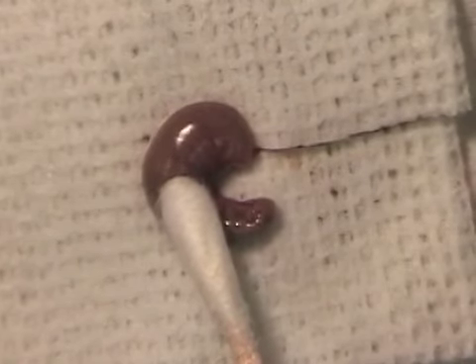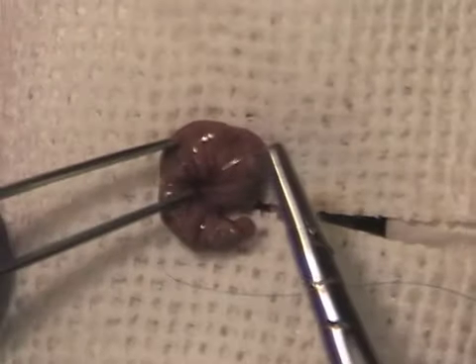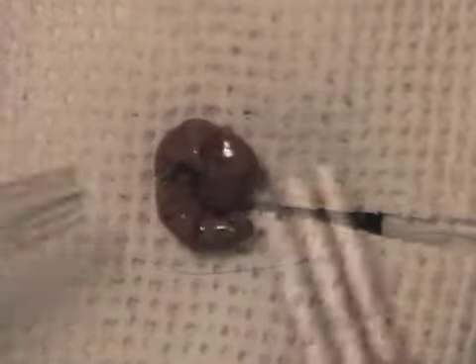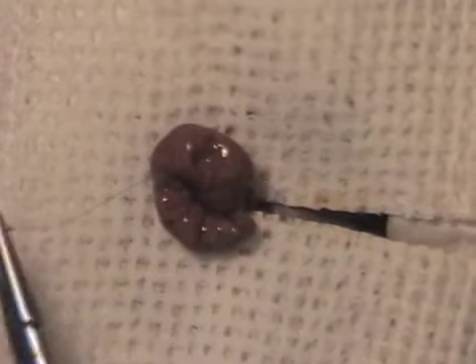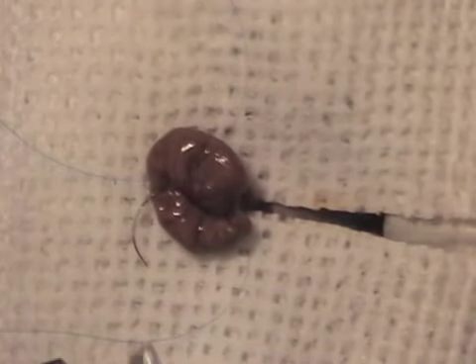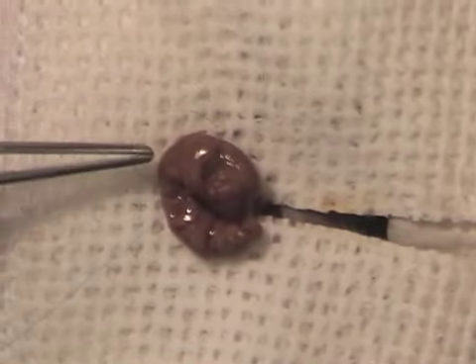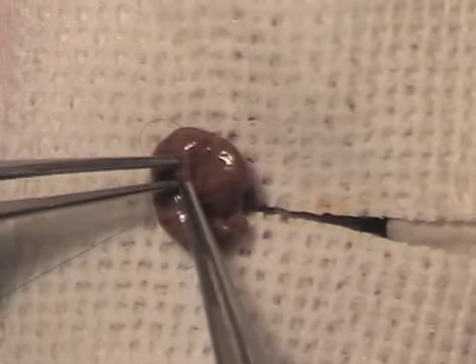In addition to injection of cells into the cecal wall, an alternative approach is to transplant tumor onto the cecum. A figure of 8 stitch is placed onto the cecum using a 6-0 or 7-0 size suture. The cecal wall is lightly damaged.